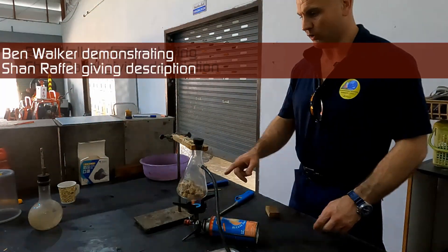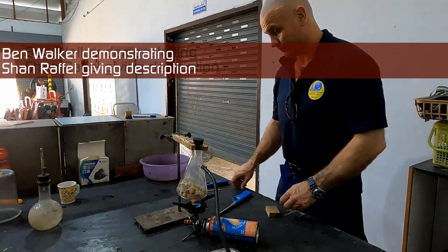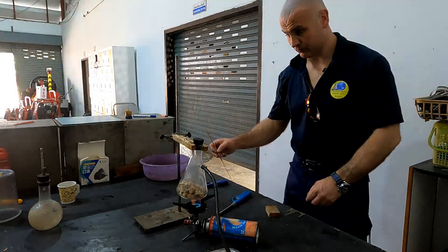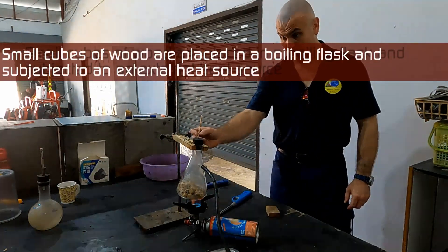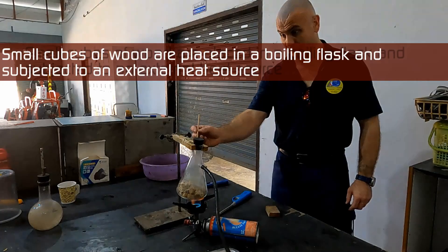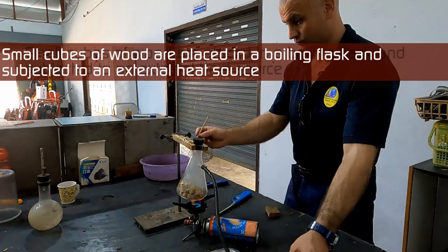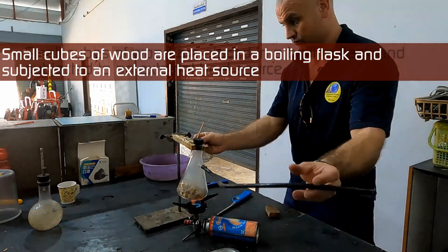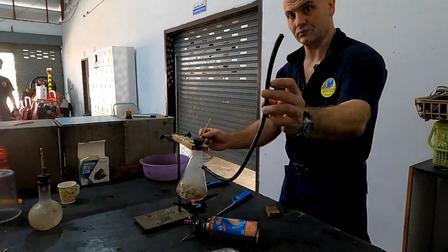A number of chemical processes are happening here. We've got our flask boiling away. Early on you can already see this white stuff coming off the wood.